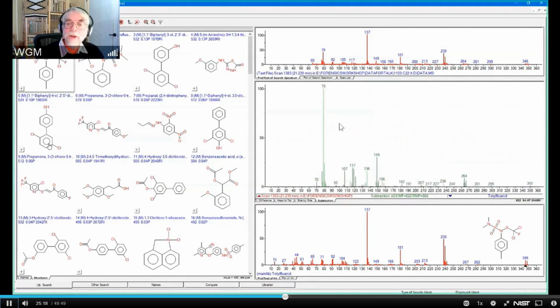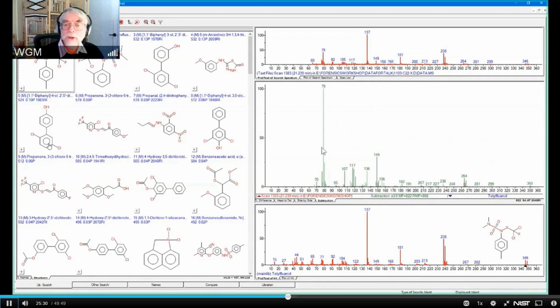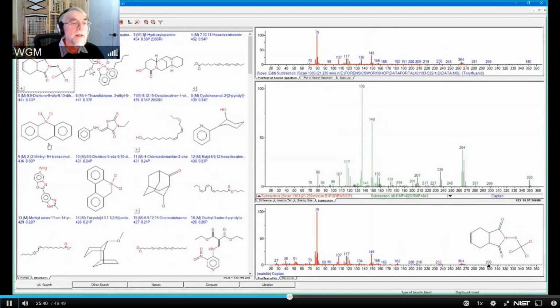Once I've gone to subtraction, what I see is the difference between this raw data and this subtracted data. That's what gets me the subtraction. Then to search this, I just right click and say do a library search on this. And now I've got an identification of captan. I'm really just repeating what I've already showed you before, but I'm doing it in real time and showing you how it's done. I've basically been able to subtract the first hit, and I get captan out of that.